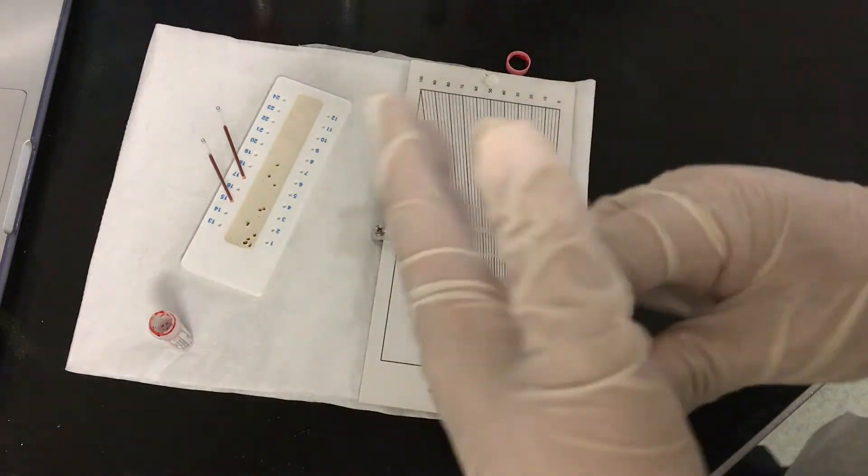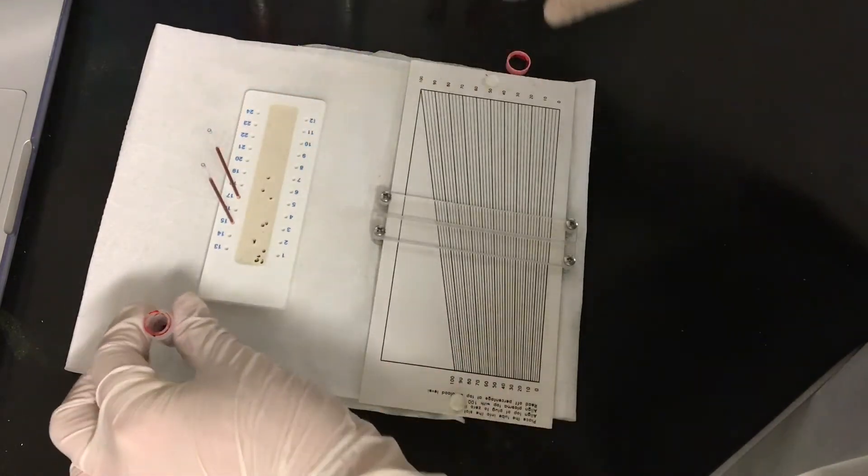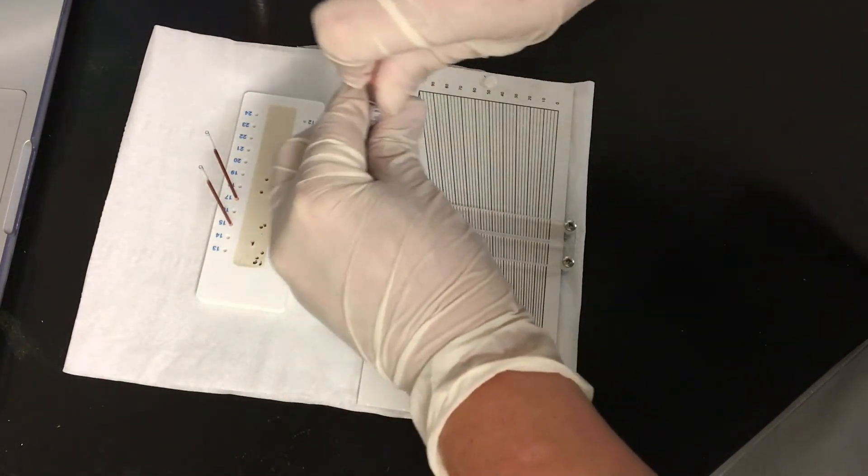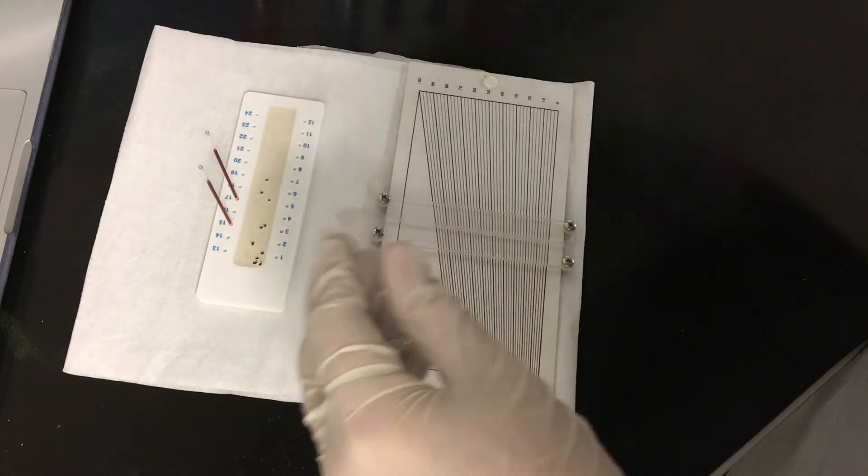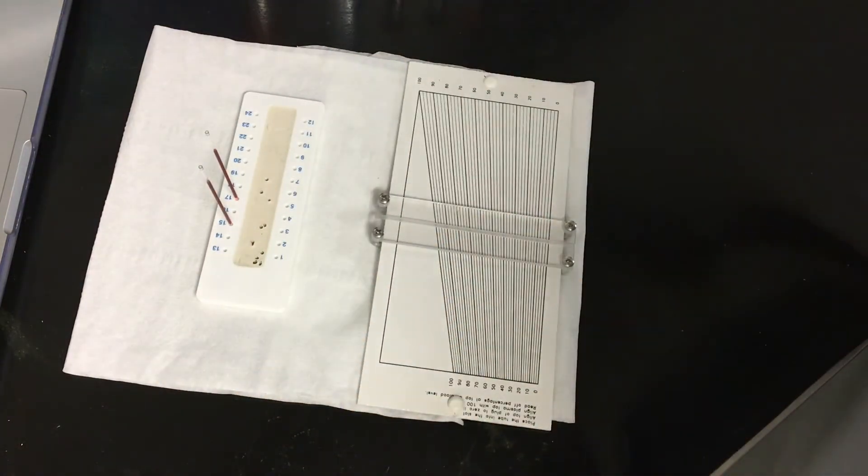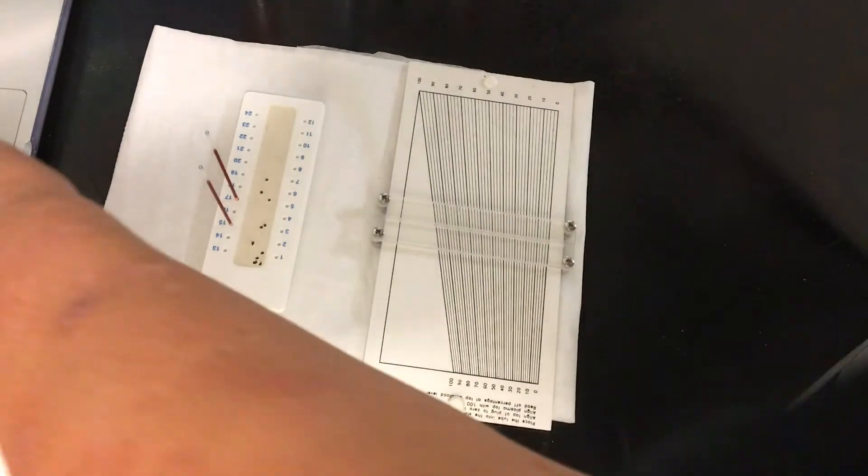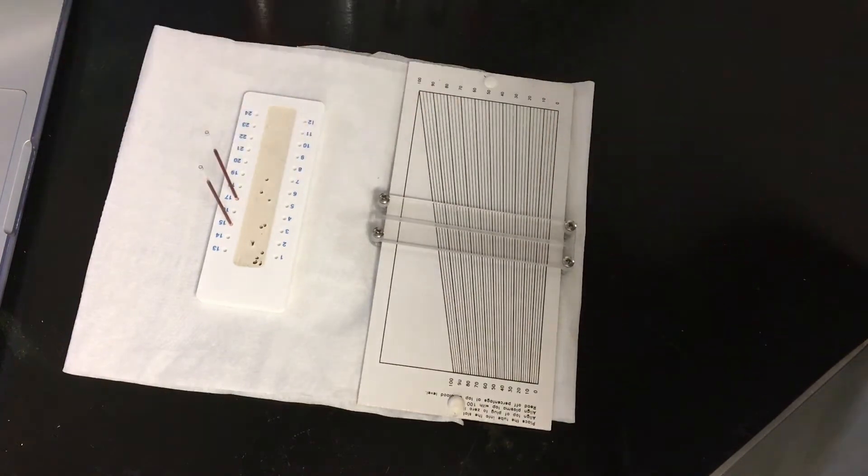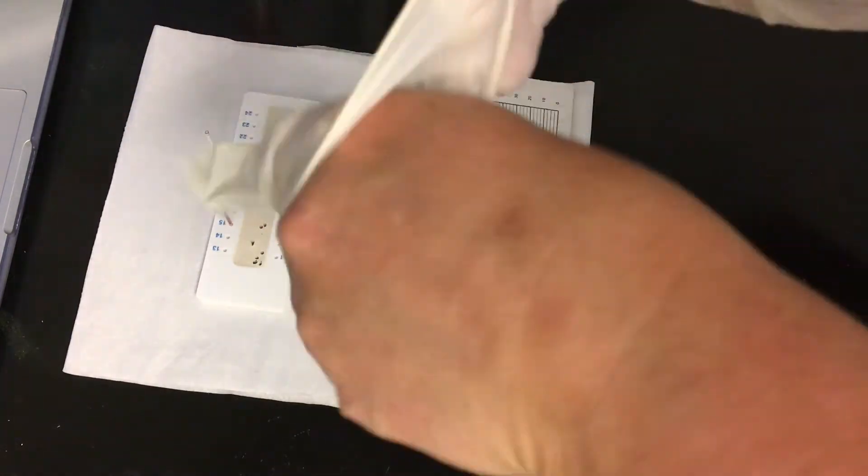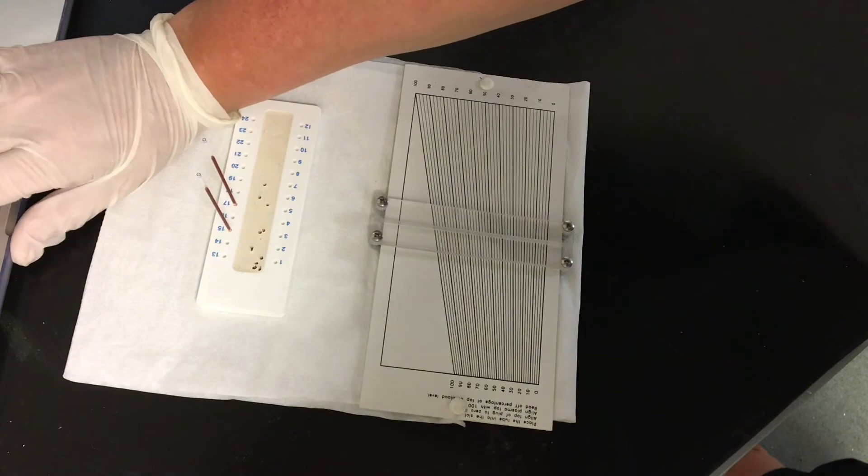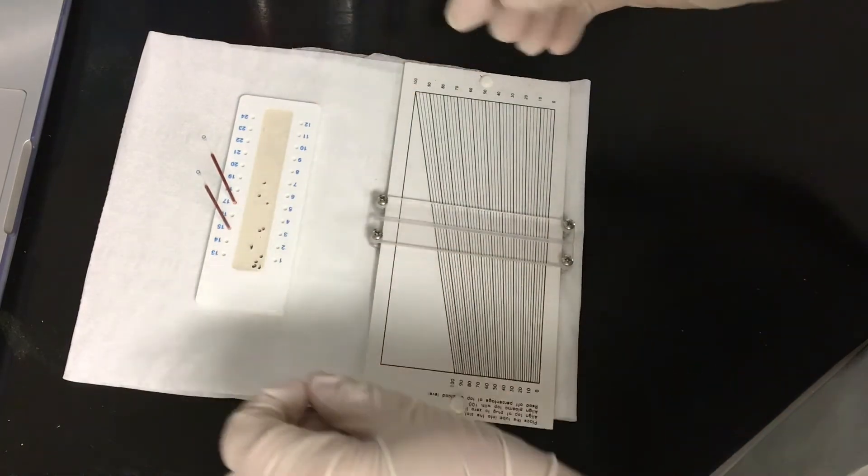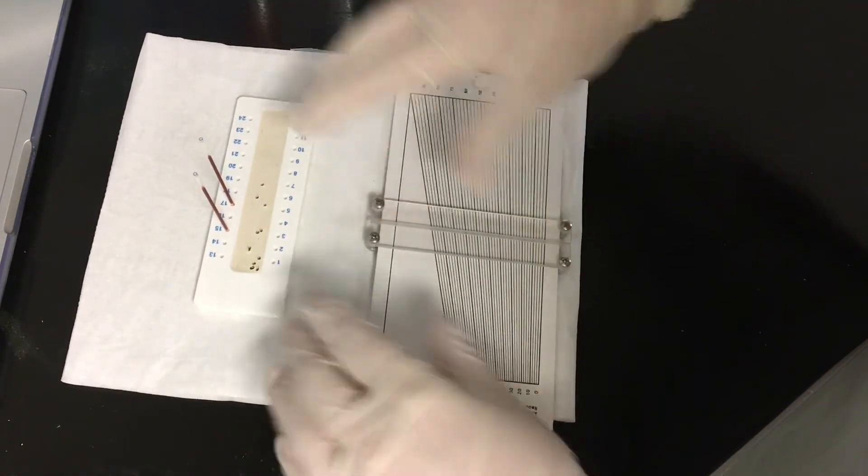So I would now spin these down. In your exam you don't have to spin them down. Put the lid back on here so that's safe. My gloves are contaminated so I am going to change gloves.